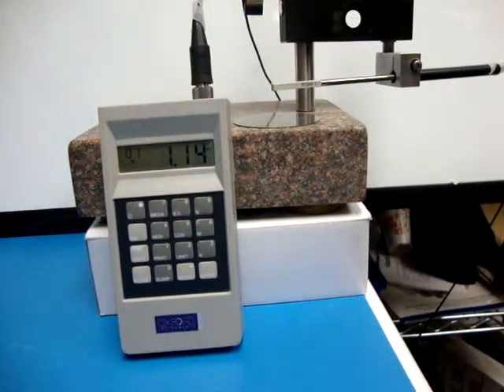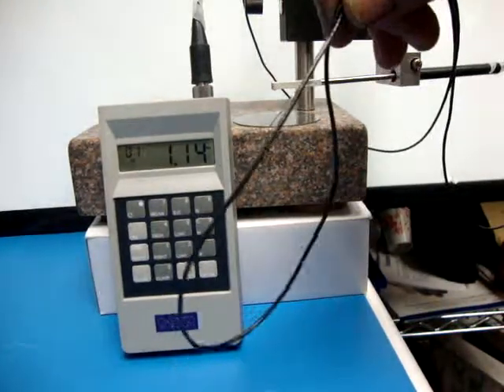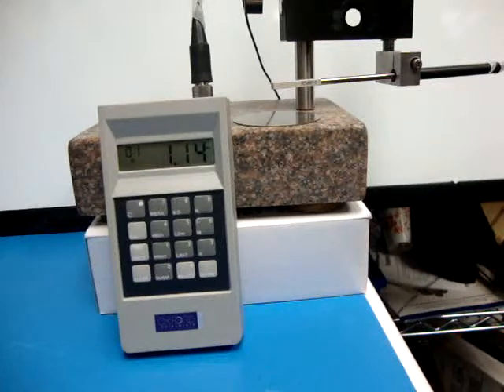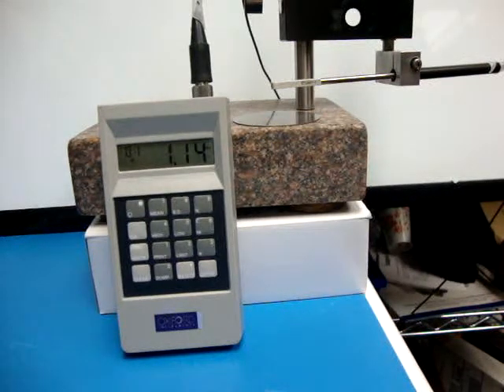Hi, this is the first probe that I fixed for you. This is actually the one with the non-standard cable. You can see it's a thinner black cable. You might like it even better. Hopefully it lasts twice as long. I don't know for certain, but I'm going to show you how to set this gauge up.